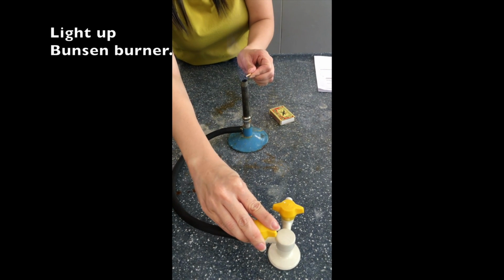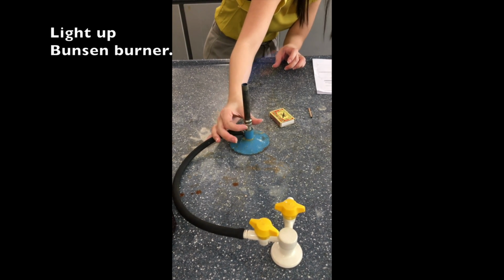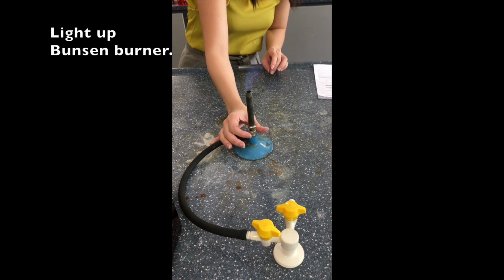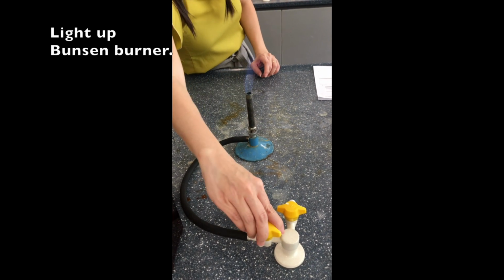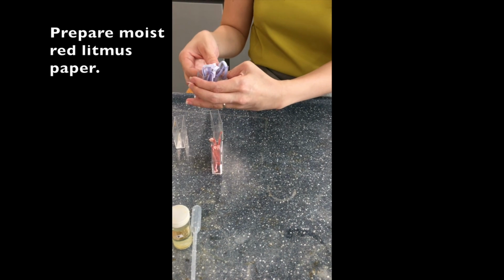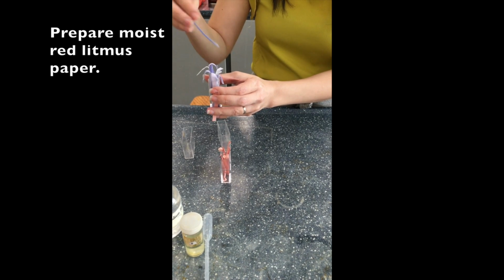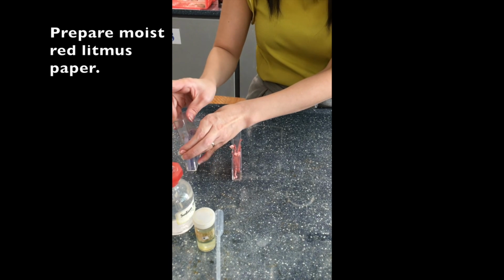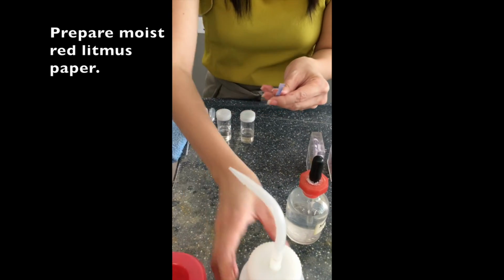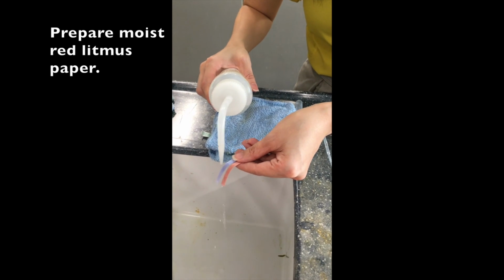Okay, so because there needs to be warming, we light our Bunsen burner first. So previously it was air hole closed, now we would turn it to an open air hole. We can reduce the gas to make the fire a little smaller. So now we prepare our moist red litmus paper. Okay, and in this case, you can always choose to prepare moist blue litmus paper as well, just to see if there is any other color changes, if there's another gas that is produced. However, the key color should be moist red litmus paper.